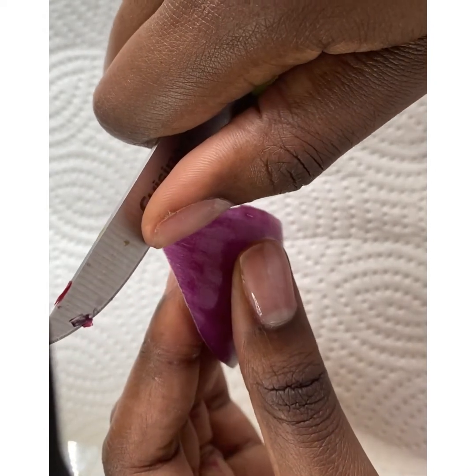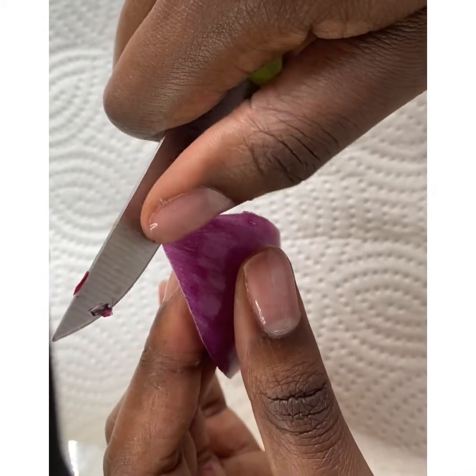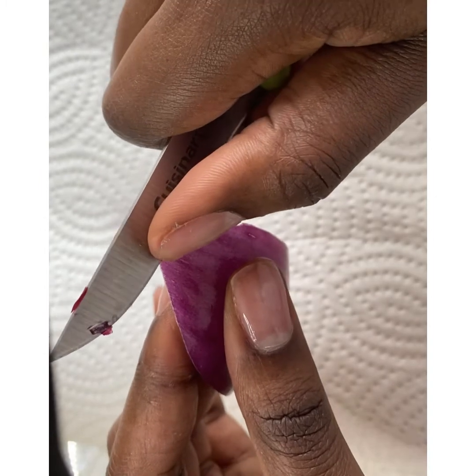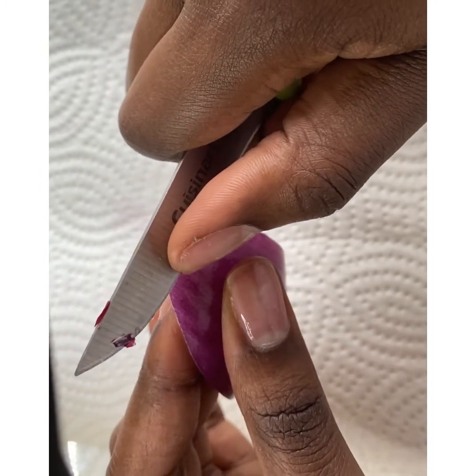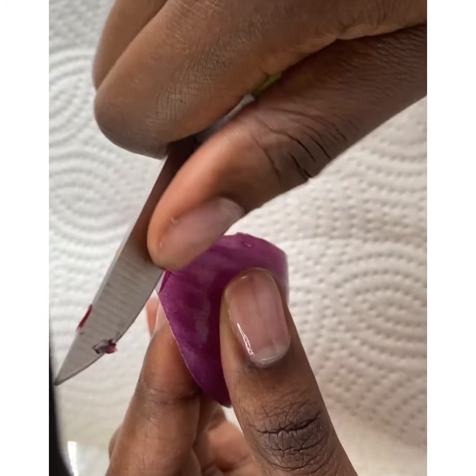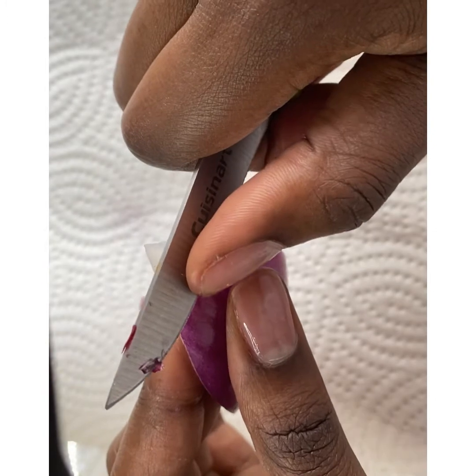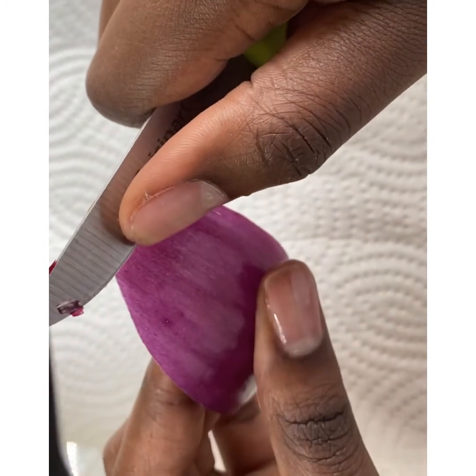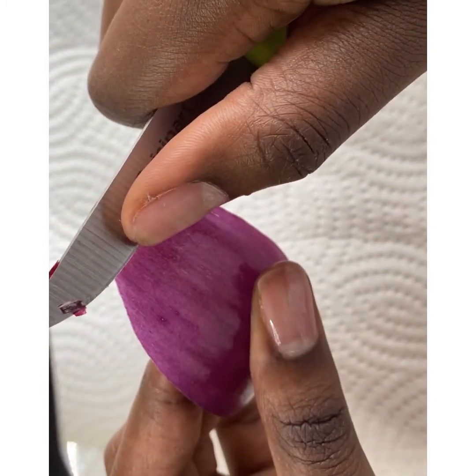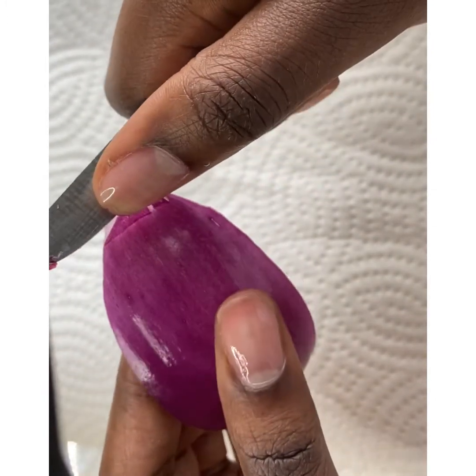Why the red part? Because it contains a pigment called anthocyanin, and this pigment is going to let us see the process of plasmolysis clearly and better.